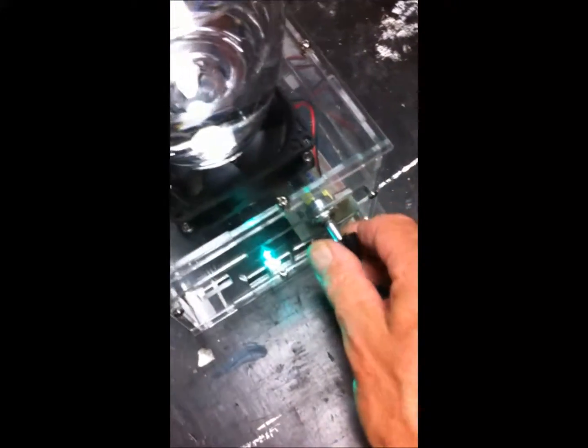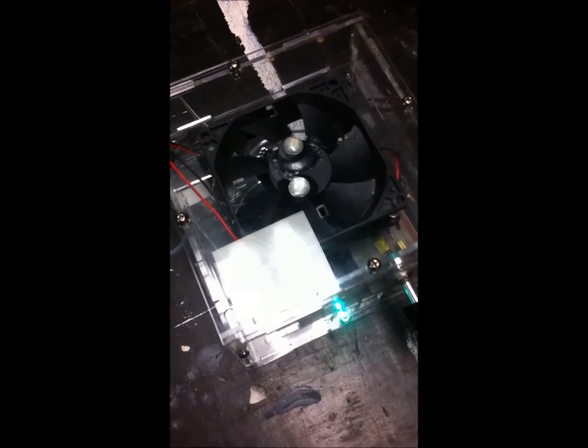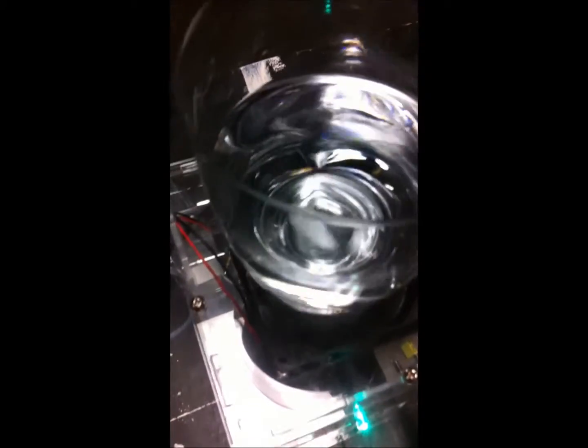I'll start to apply power and you'll see that there's nothing happening. That's a design of this type of fan. With this type of fan motor, they're very prone to getting stuck in a particular point. All computer fan motors of this variety are like that. So you just give them a little bit of a kickstart and they go quite nicely. But you always have to do that, unless they're one of those very nice stepper motors or something else.